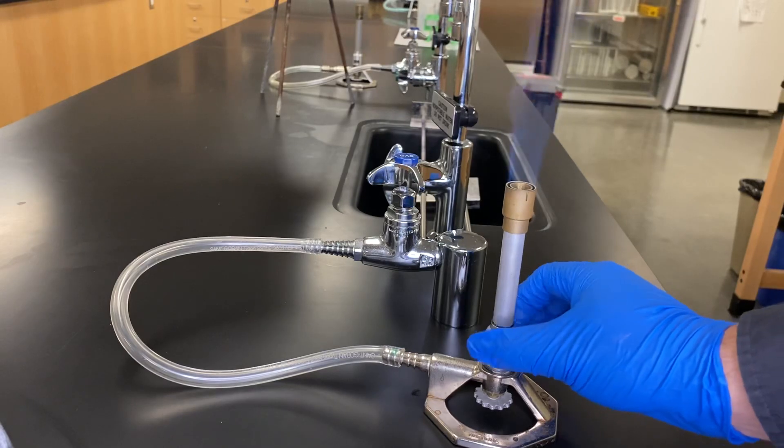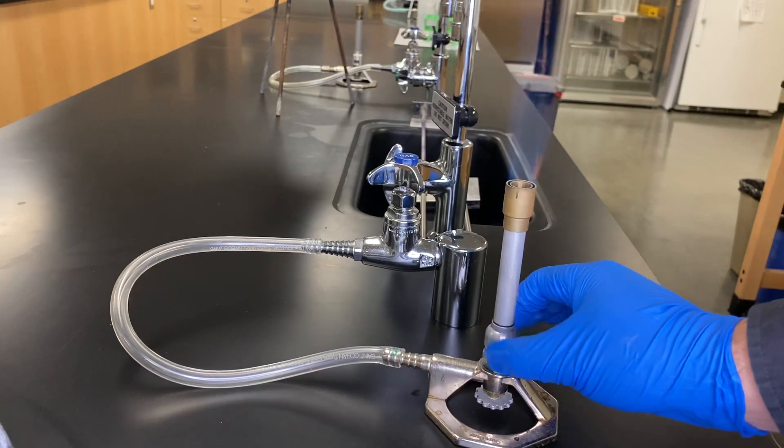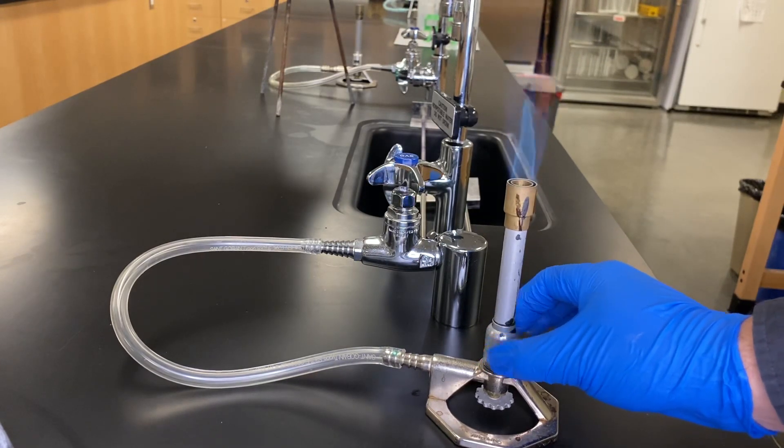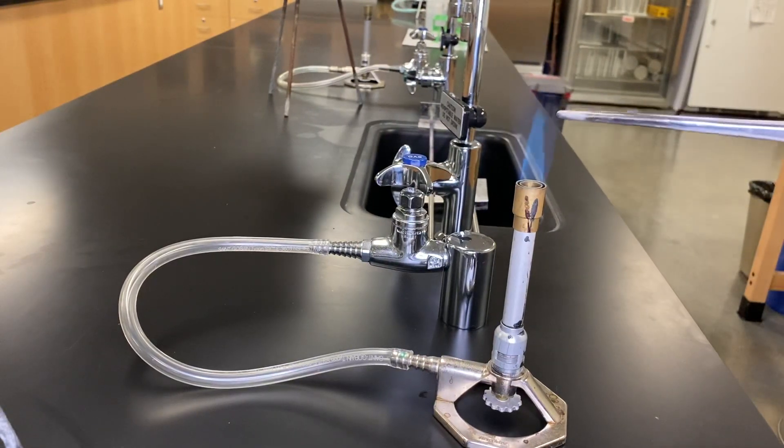And then when we're trying to sterilize things, we'll open it up a little bit more until we get that two-cone system. And we'll use this specific area right here to try and sterilize things.